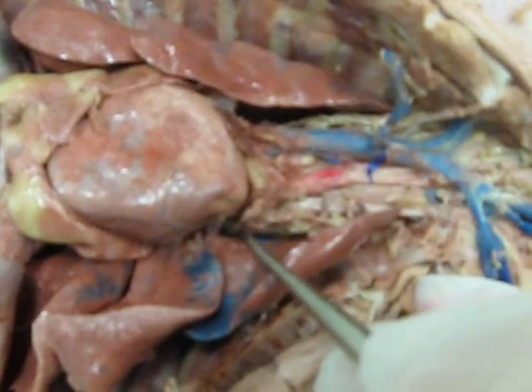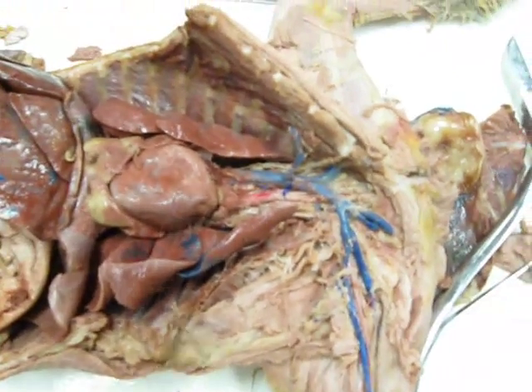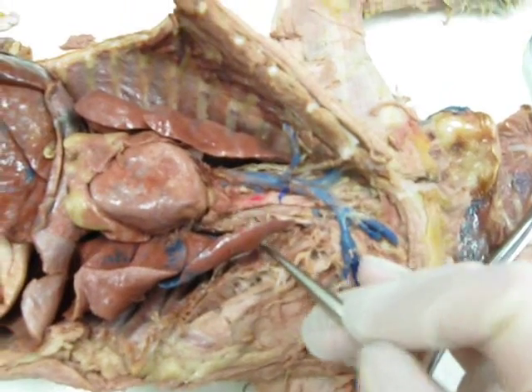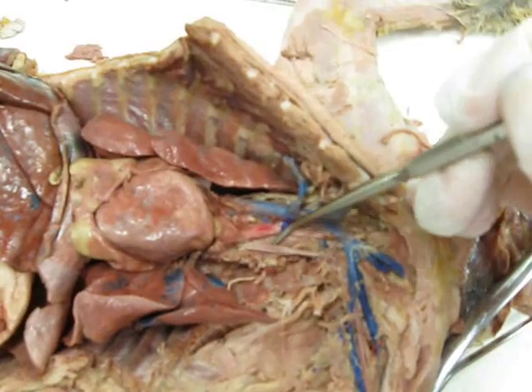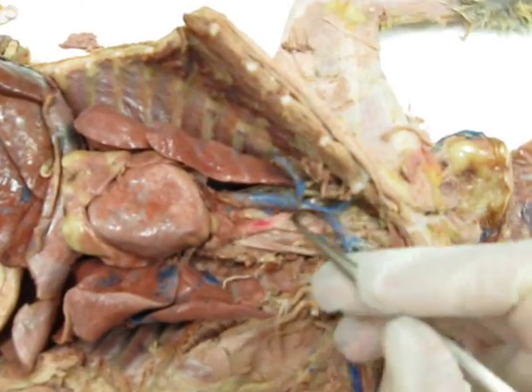Now your arteries, you're going to have your aortic arch coming from the top of the heart. Okay, right behind that fat blob. What is this? Okay, and then from there you have your two branches in the cat, brachiocephalic and your, lung out of the way, left subclavian. The brachiocephalic then leads up to 3 branches.